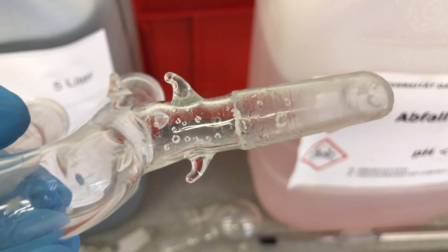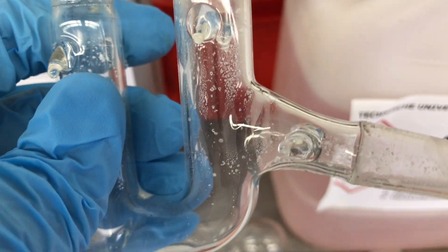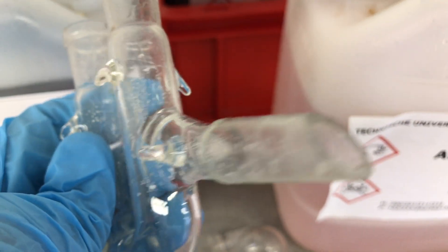During the cleanup, I noticed that there were some solid specks in the distillation equipment. This is actually chloral hydrate—some chloral hydrolyzed and reformed chloral hydrate.